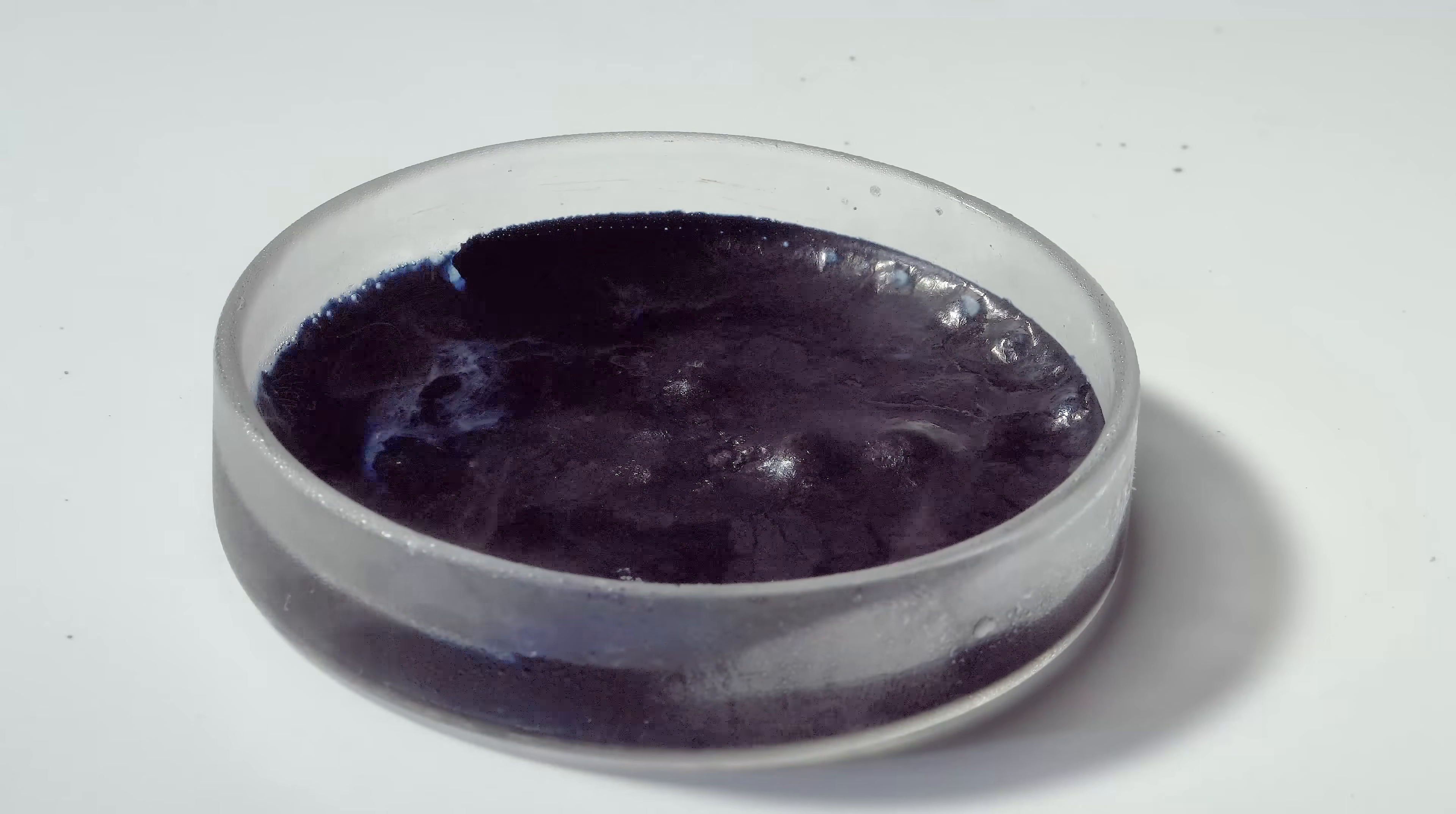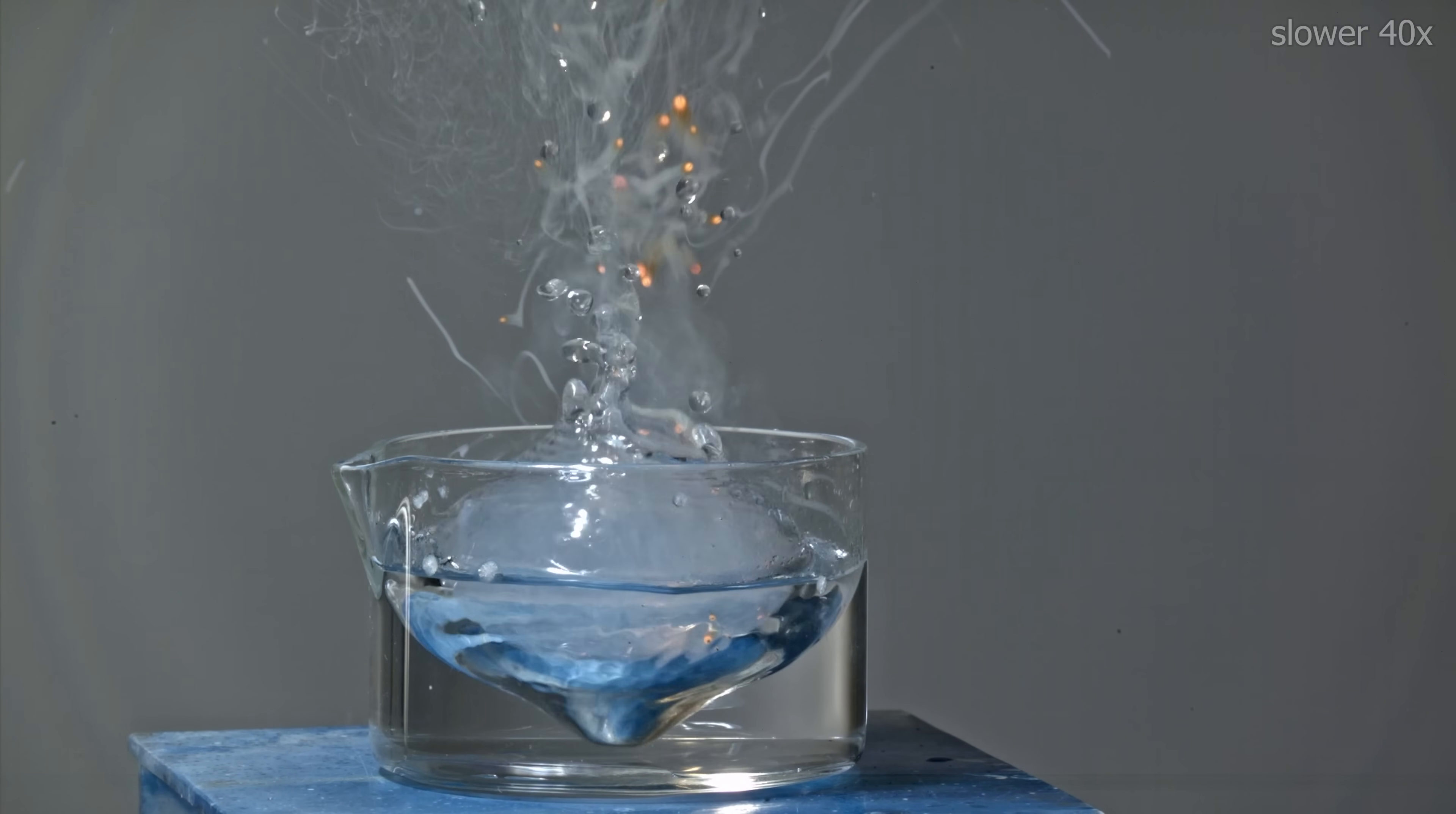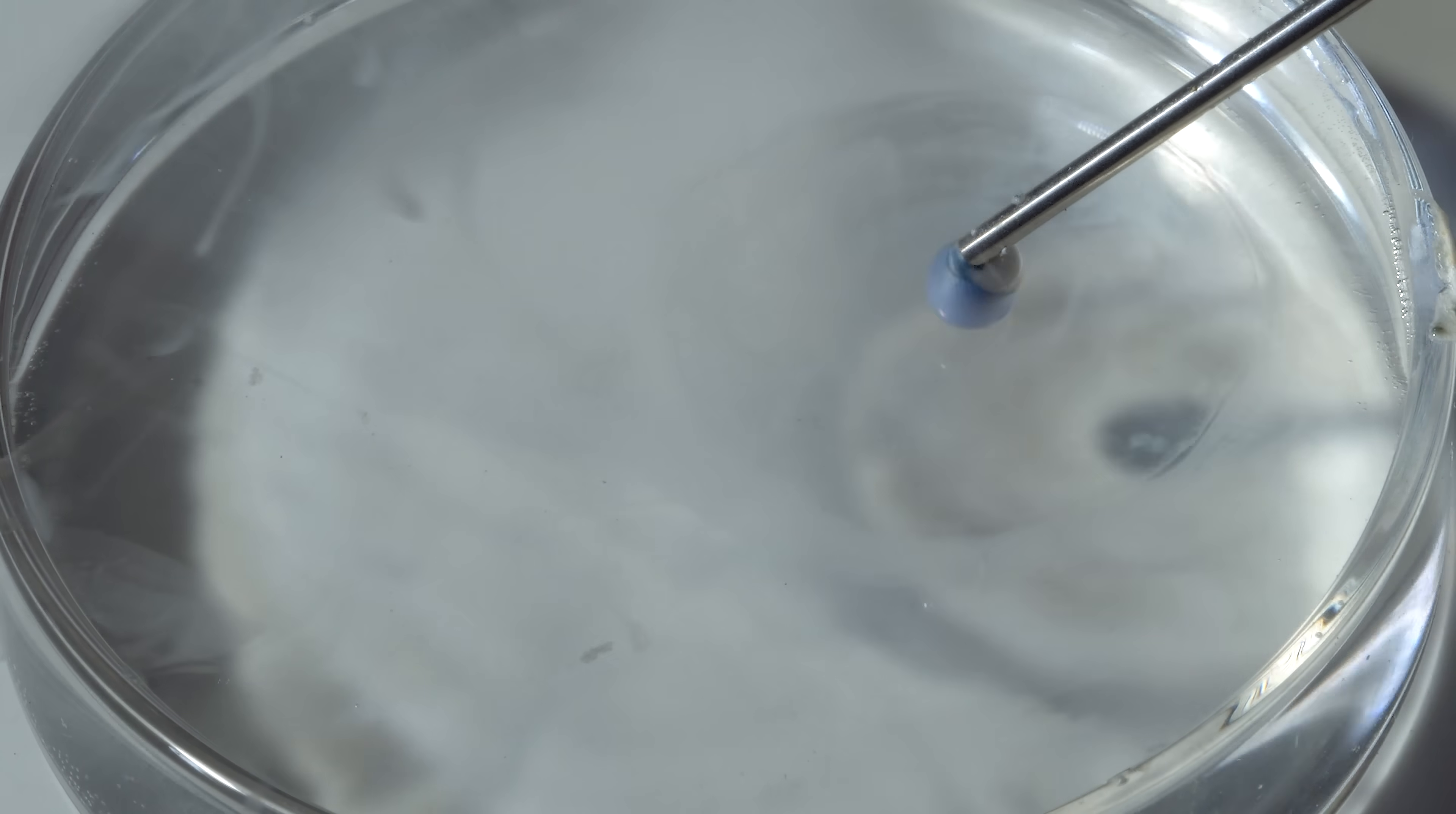Dropping a sodium-potassium alloy into water will result in an instant explosion, with sparks of burning metal flying around. Even if we carefully touch the water's surface with a drop of the alloy, it will ignite as well.